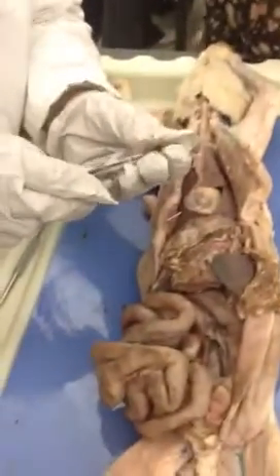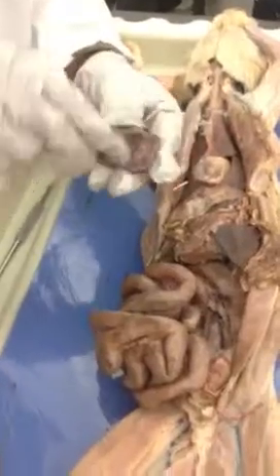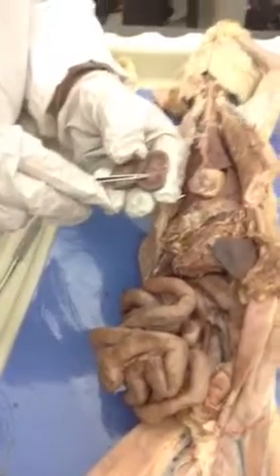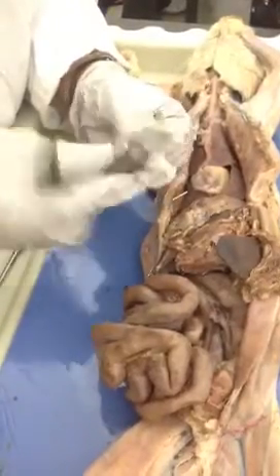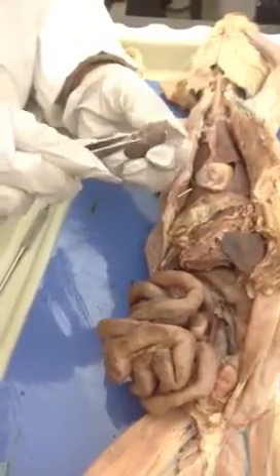All right, on the kidney, you have the renal capsule on the outside. You have the two layers, the cortex and the medulla. This would be the hilum, because it should have been this way and cut this way. So this is the hilum, where things come in and out.